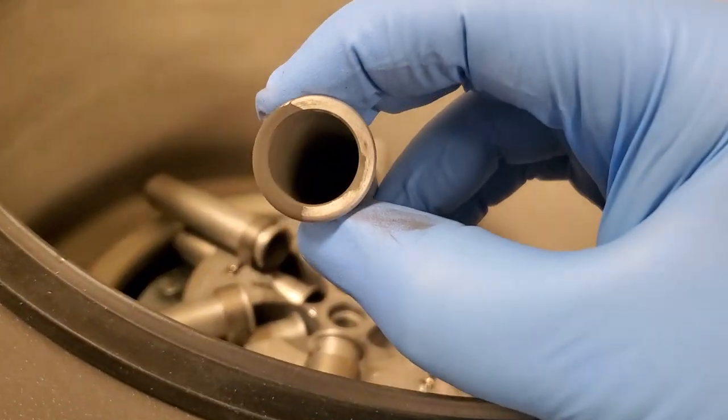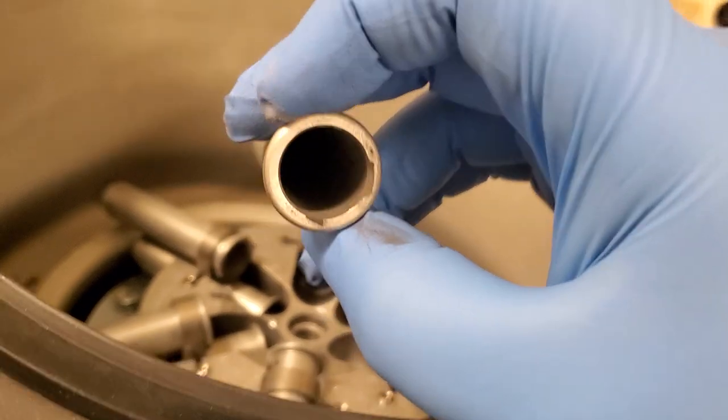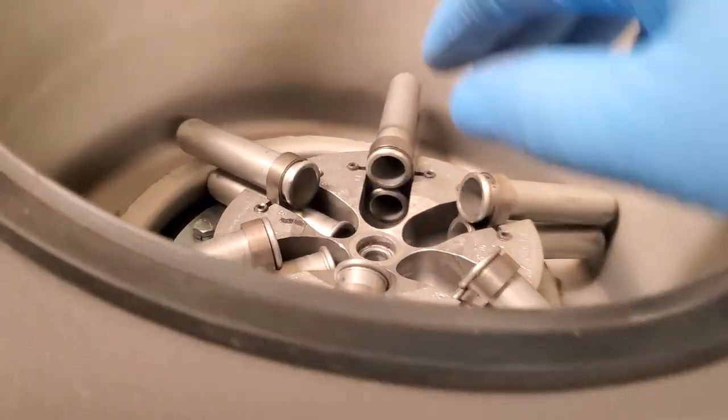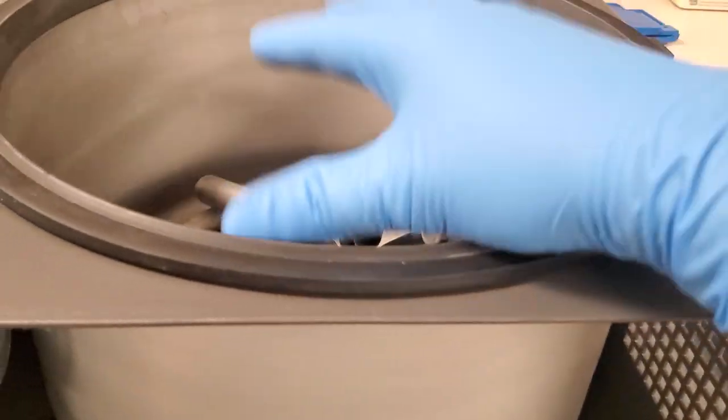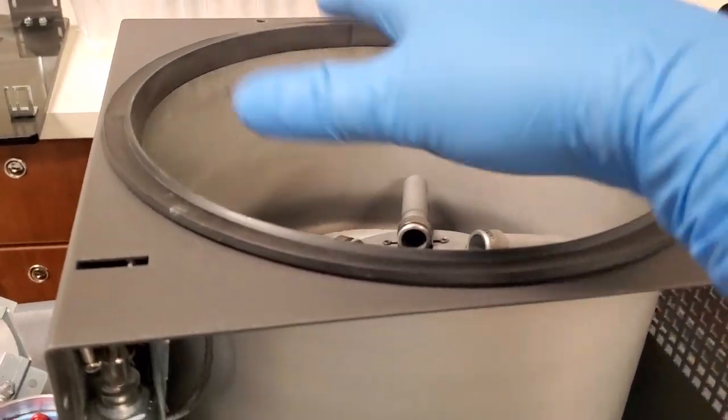because you can see the dust. Look at the dust inside here. That's all dust, guys. See it? So we have to clean each and every one of these with probably soap and water, get it really, really clean and really, really dry, and then we can power it up and check the vibration of the rotor once the new motor is installed.